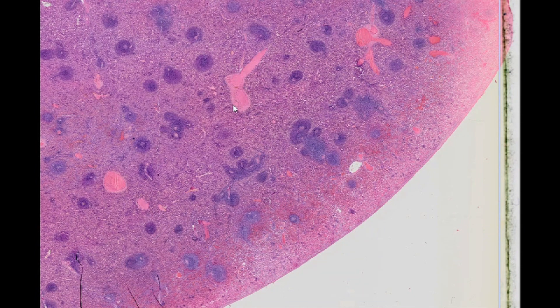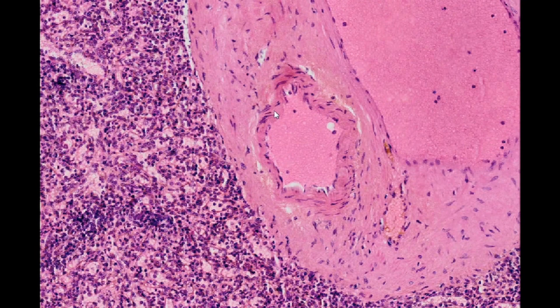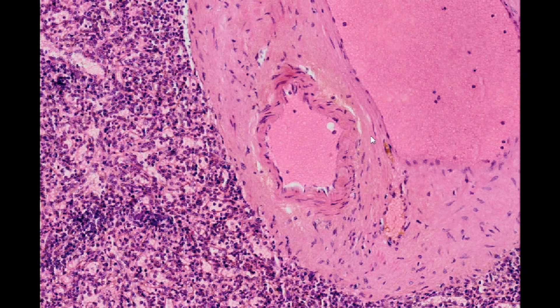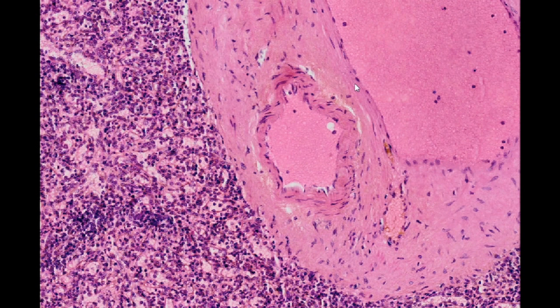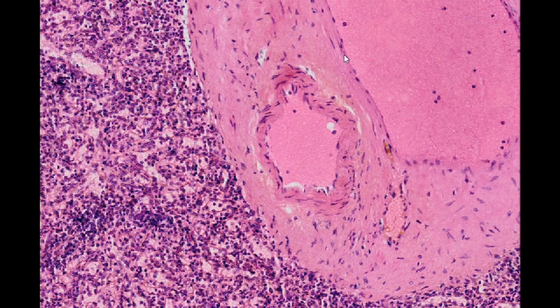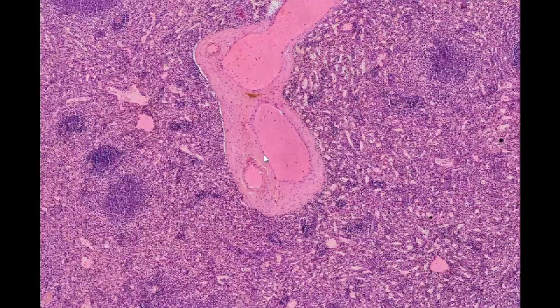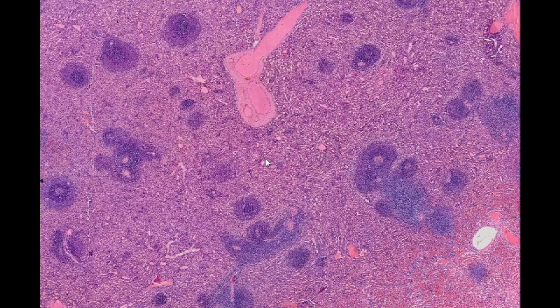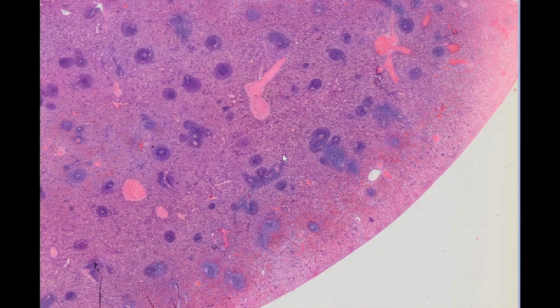The presented example is a trabecular artery with a distinct, well-developed tunica media. In contrast, a cross section of a trabecular vein is characterized by a tunica media poor in smooth muscle cells. The spleen stroma is made up of reticular connective tissue, and the organ's architecture is composed of two separate areas, known as white pulp and red pulp.